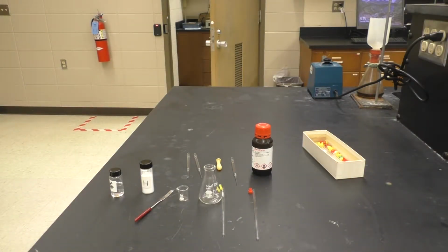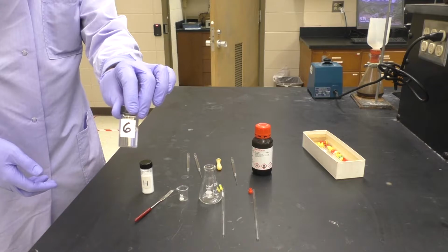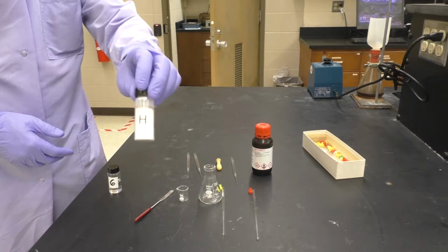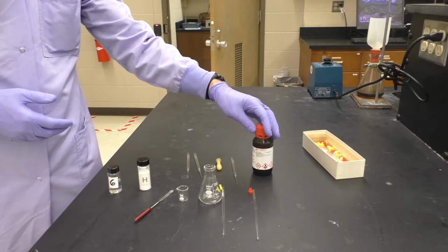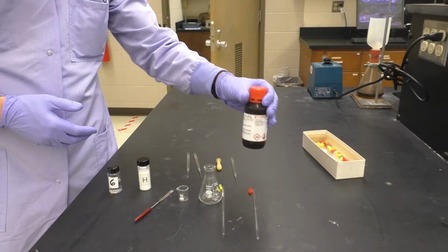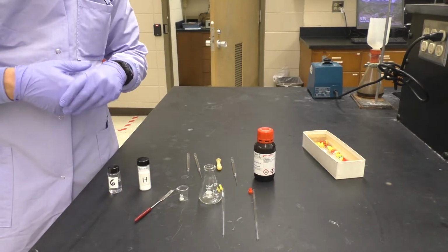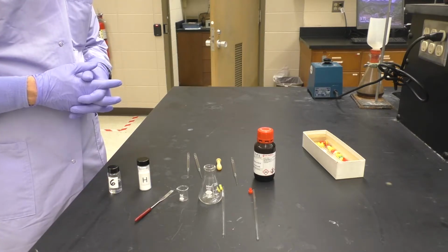When it comes to prepping samples for NMR analysis, there are two methods depending on whether the sample is a liquid, as we have here for unknown 6, or if the sample is a solid, as we have here for unknown H. Now, the other things that we need here is some deuterated solvent for NMR. Most of the time, deuterated chloroform is the most common, and that's what we have here, but there's also deuterated acetonitrile, deuterated THF, deuterated benzene, many other deuterated solvents that can be used for NMR analysis.